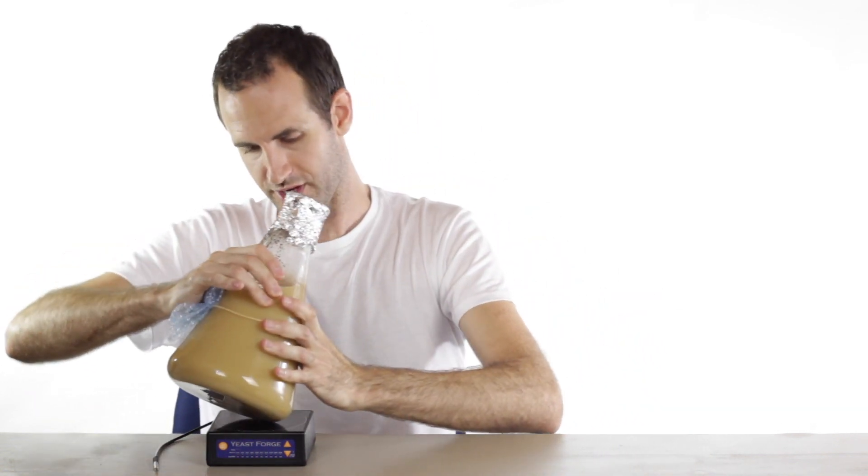I'll just show you a quick demonstration on how to get accurate temperature readings with it as well. You can see here I've got my starter in the flask and I've used a little bit of bubble wrap and an elastic band to hold it in place.